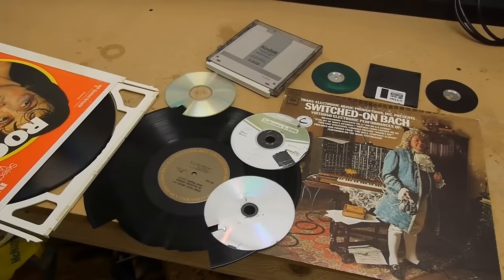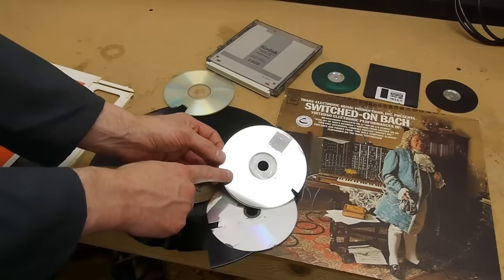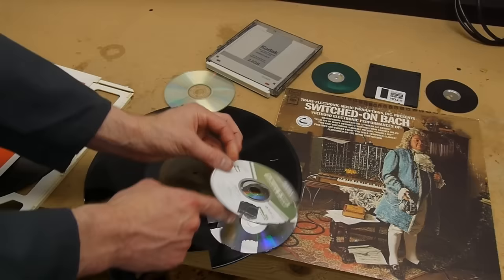I also wanted to take a look at a CD-ROM. These are read with a laser, but we can't just put this in the electron microscope either. Even though the metal is aluminum, it's behind plastic. On this side it's just polycarbonate on the surface, and on this side it's this protective lacquer label.